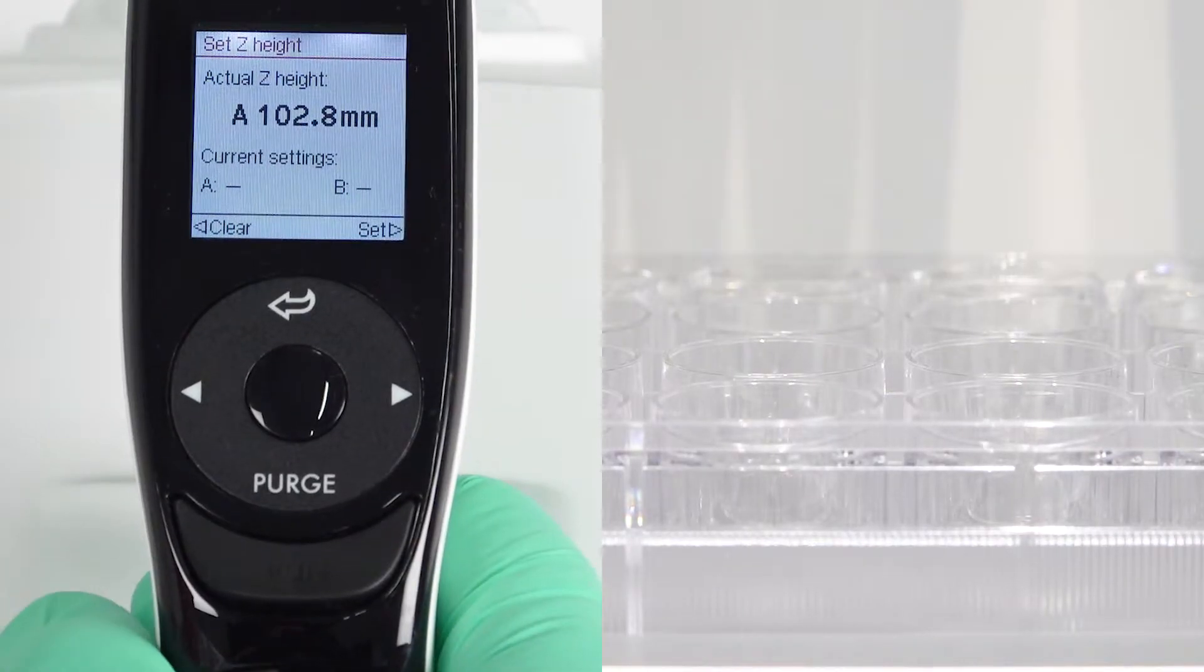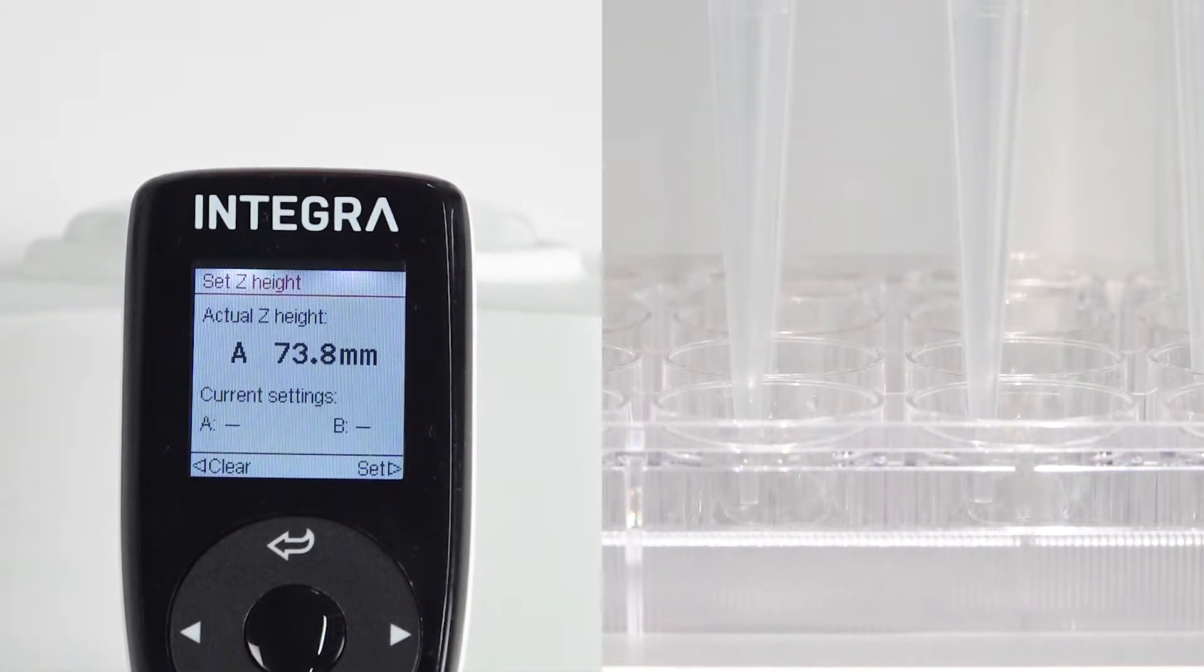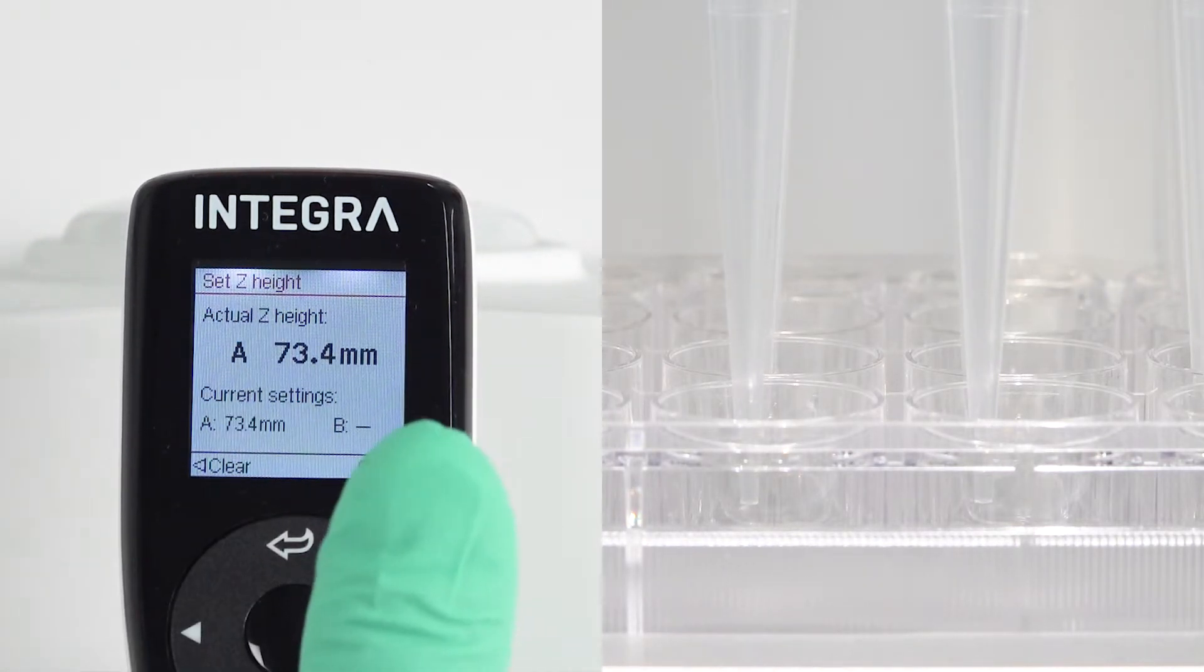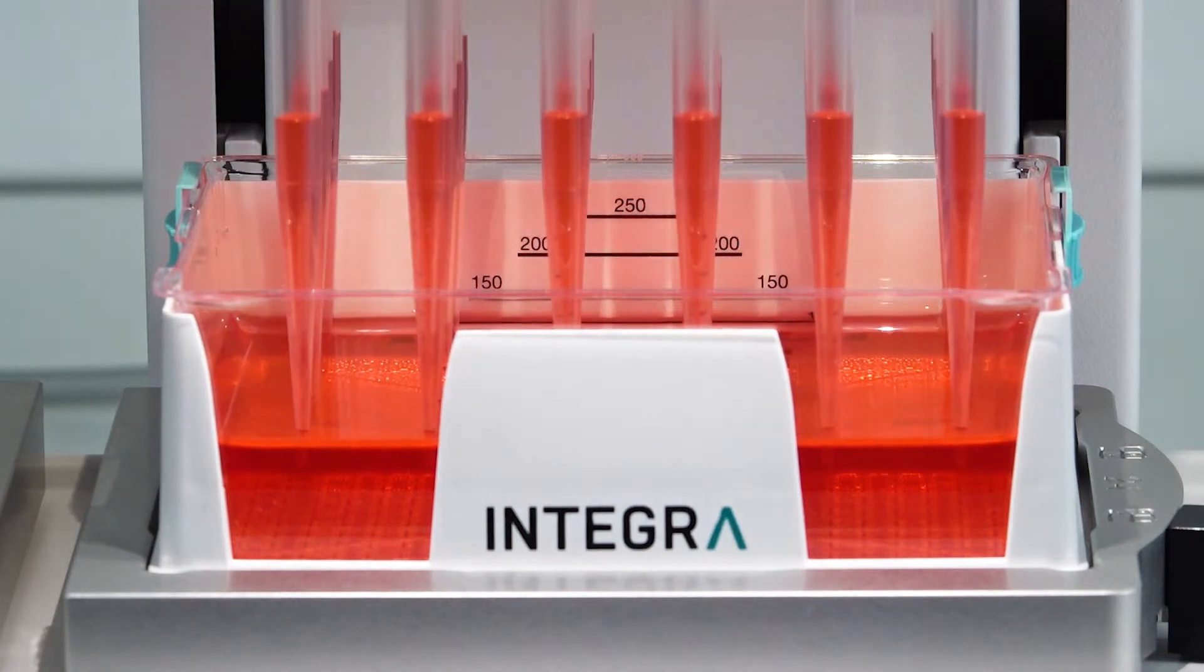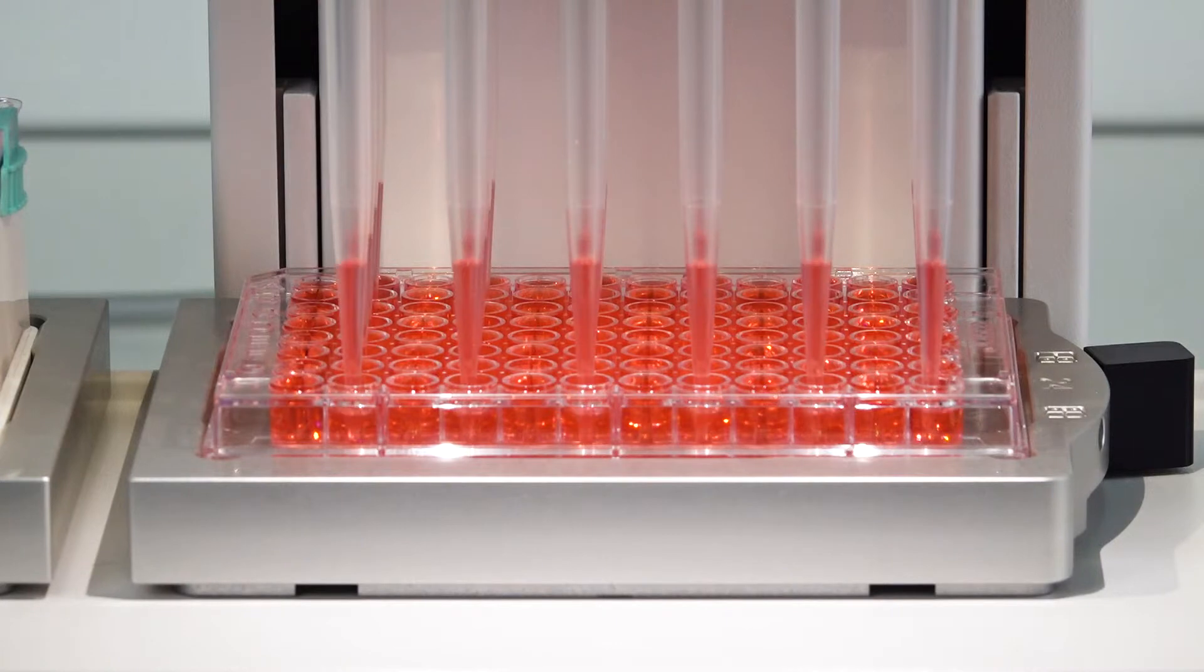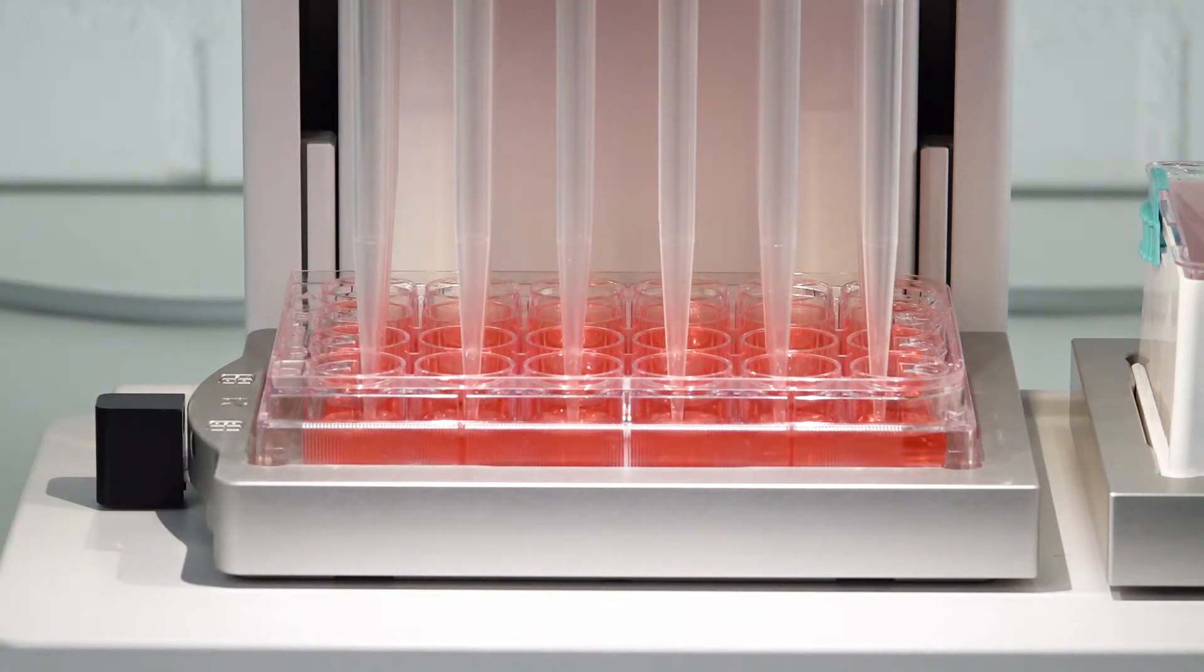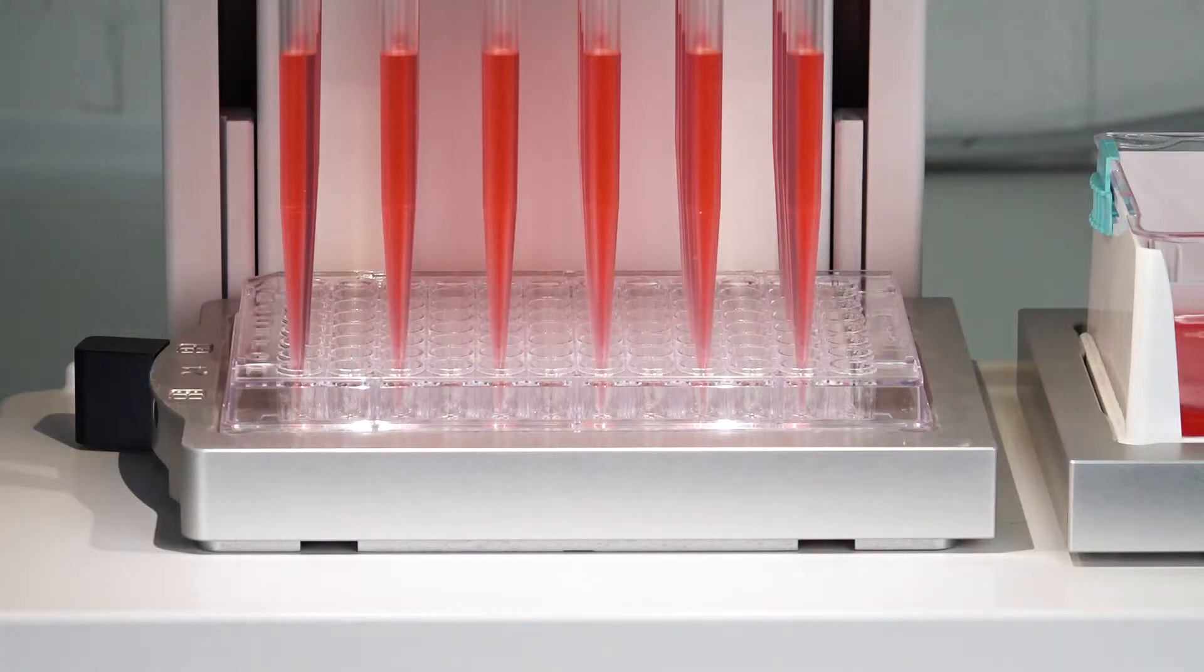Enter your program and define the heights of pipetting so you don't crash into your labware. You can aspirate from a reservoir 24-well plate or a 96-well plate and simply dispense into your target 24- or 96-well plate.